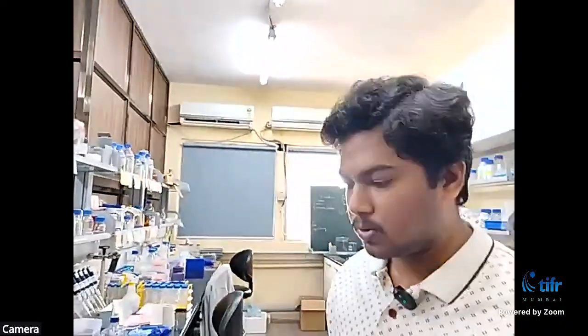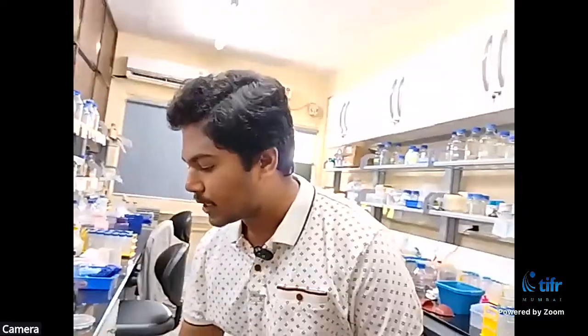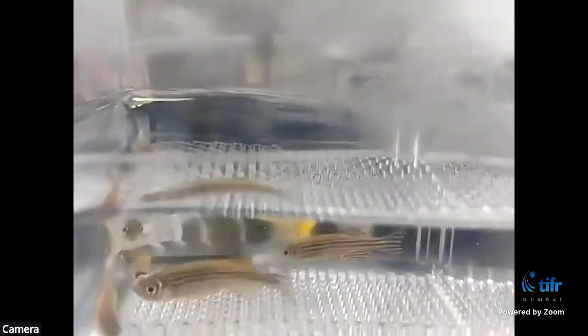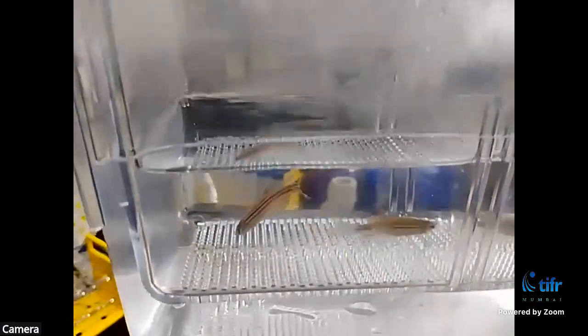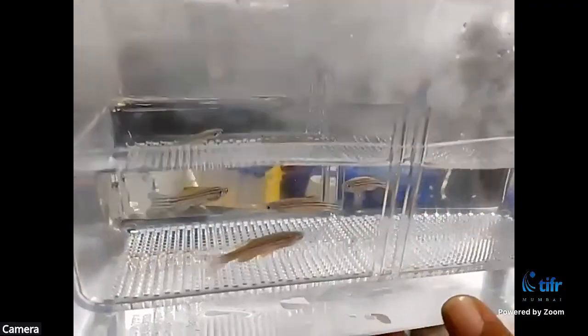On the day we want embryos, the previous evening we introduce a male and a female in these types of breeding tanks. So now a question arises: how do we differentiate between male and female zebrafish? If you observe carefully, in the tank, there are some characteristic features, like there are fishes which are more pinkish than the others. Those are males. That is how we recognize them. And for the females, the identification feature is that they have a bulged belly because of the egg pouch.